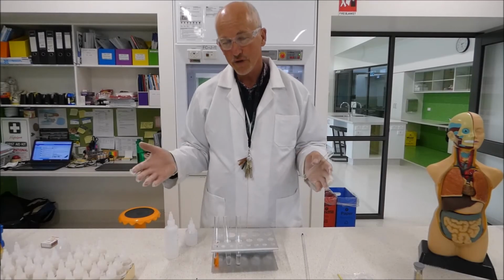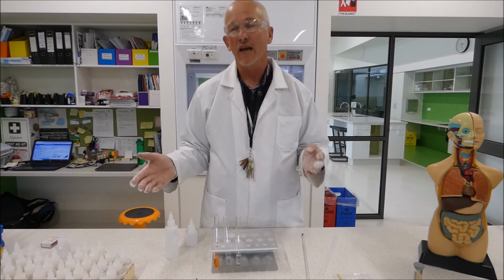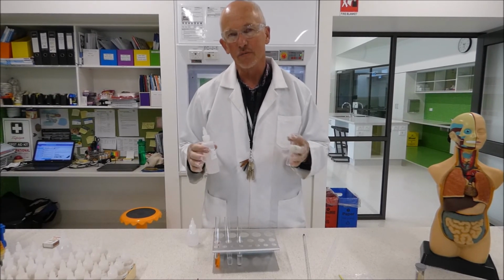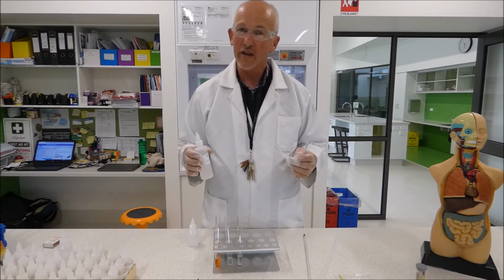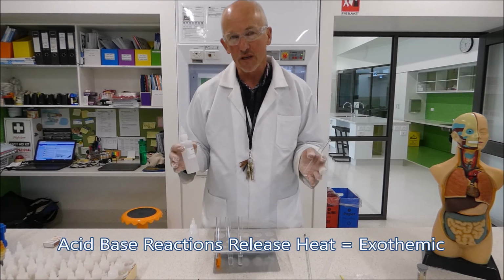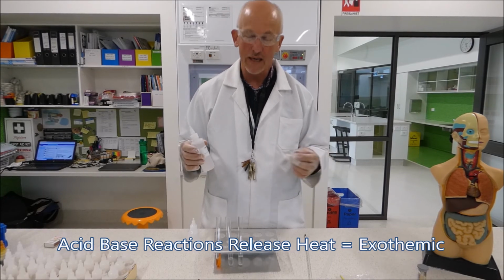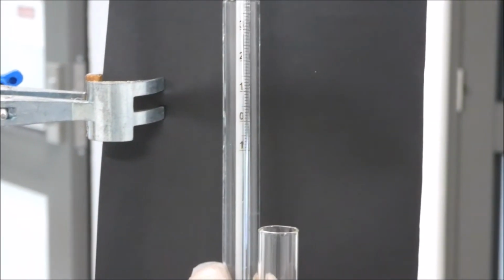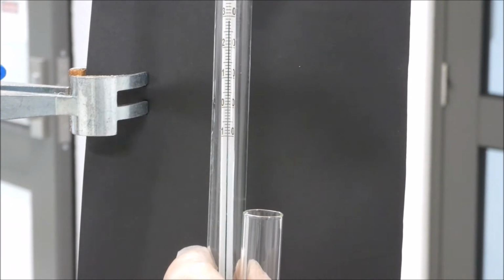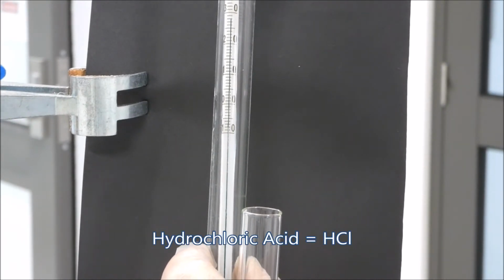Right, and for our fourth experiment we're going to do an acid-base reaction. And acid-base reactions can be observed in lots of different ways, and one of the classic ways is actually to get a temperature change or an energy release, so you get the temperature going up or down. Alright, so we're going to do our acid-base reaction here in front of the black paper so you can see it. We're going to add hydrochloric acid to the test tube.